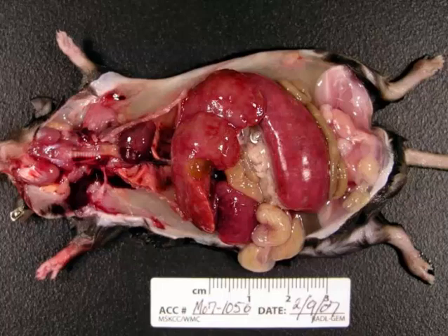Additional things that you'll see in animals with histiocytic sarcoma include hyaline droplet renal disease, as the tumor cells secrete lysozyme, and this is accumulated within the epithelium of the kidney, as well as a generalized decreased myelopoiesis.